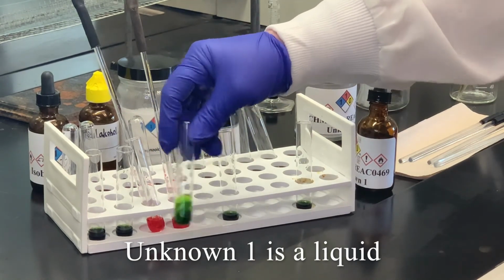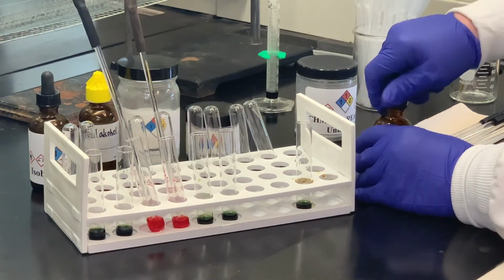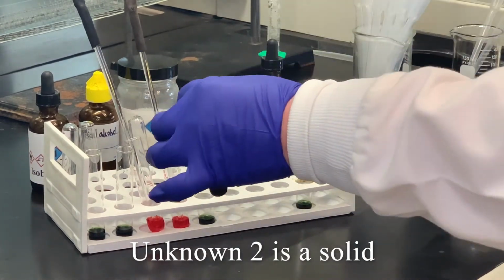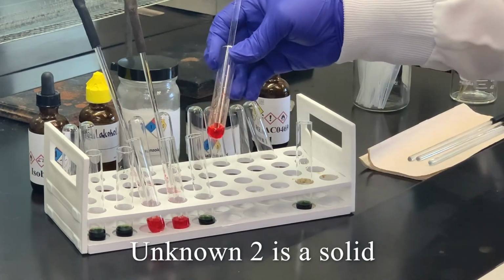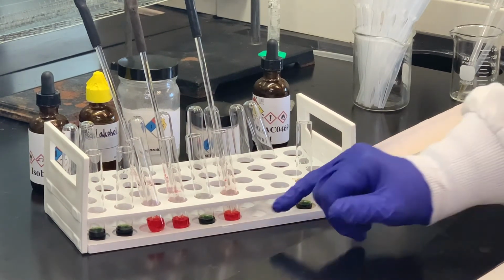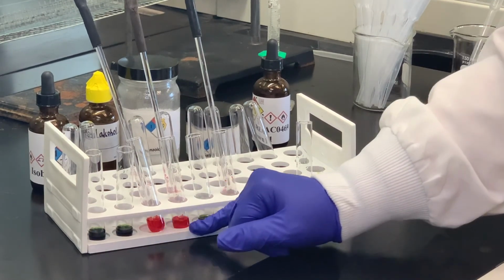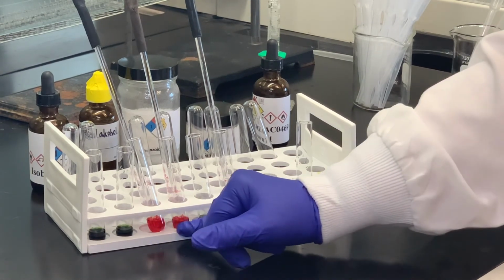And as you can see, no change there. And then the last unknown we have is a solid. And as you can see, this one changed to that pinkish red color. So in terms of identifying the unknown, we can't really tell which of the acids it was. We're assuming this is a carboxylic acid because it has the same color change as the other known acids. But we can't look at this and tell which one is which here.